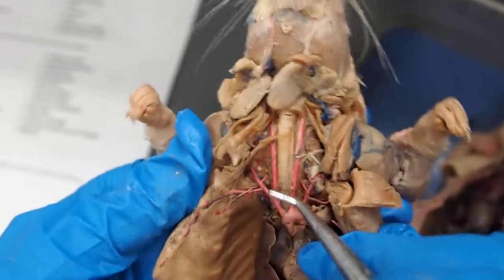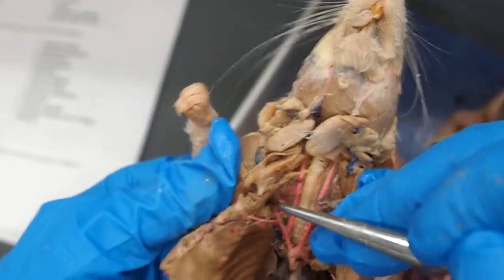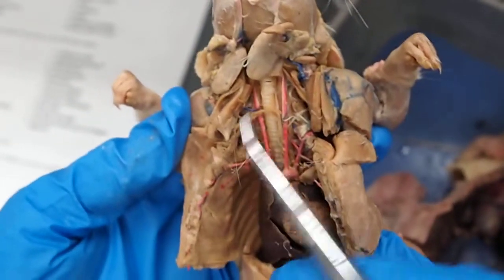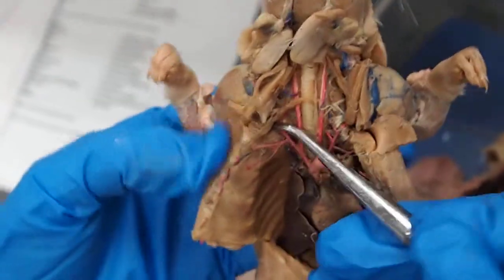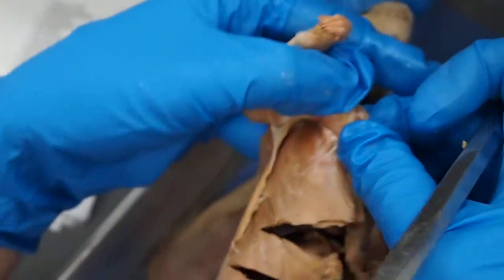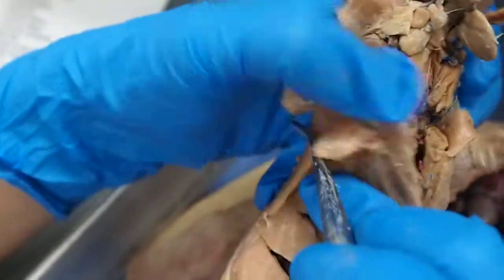Internal thoracic, costocervical, right subclavian, superficial cervical artery, and then the one that you can see going inwards on the bottom, that's the lateral thoracic. I'm sorry, the axillary. The axillary goes into the body wall, and what you'll see is under the armpits, the one that's kind of outside of the body, this one right here, that one is the lateral thoracic, and then the brachial is this one right here that goes into the arm.